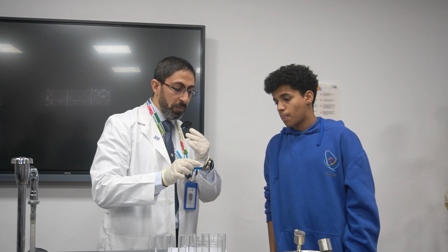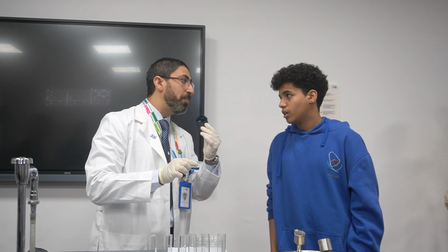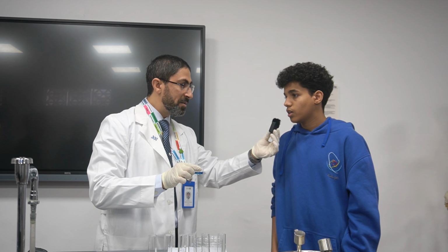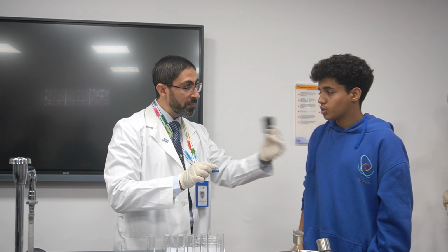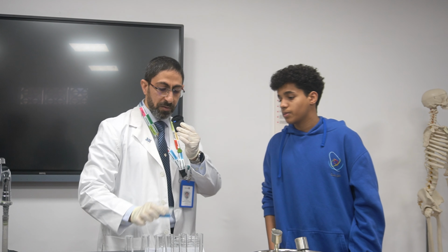So in this case, the inside of the plant is hypotonic in comparison to the outside. So it has higher water potential outside or inside? High water potential inside the plant. Exactly. So the water will be moving from inside the plant to outside. So the color intensity will be darker. Exactly. Thank you very much.